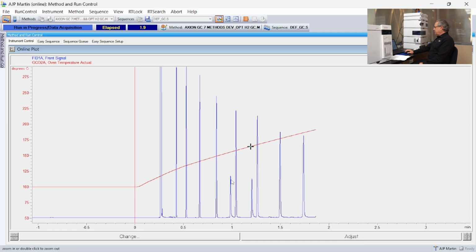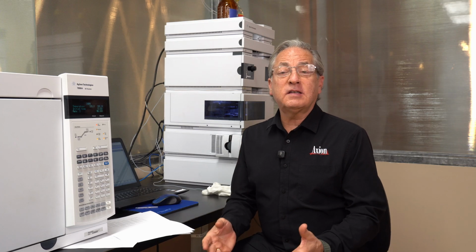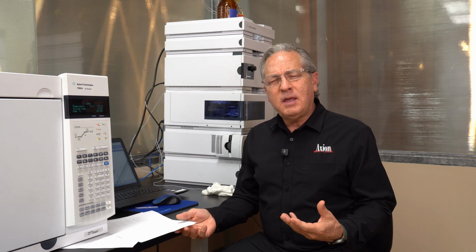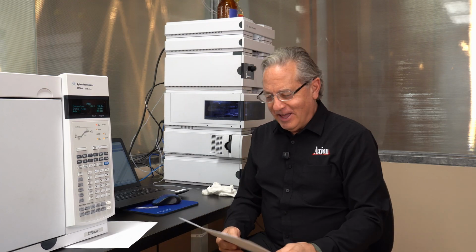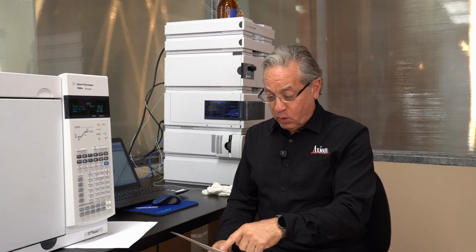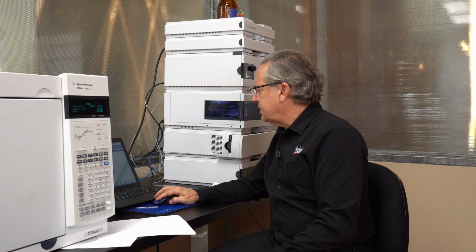So that's the 10th peak. Okay, so our little fix seems to have worked. If you remember what happened, we were running the sample that had the alcohols in it. The 2 alcohols were giving tails, and I see a lot of peaks, and right away it jumped out at me that it's tailing. But if it doesn't jump out at you, that's okay. Eventually it will. But if you look at the output, I'm using what's called a performance report in the Agilent systems, and not only does it give me resolutions, which we've been looking at, but it also gives us symmetries.